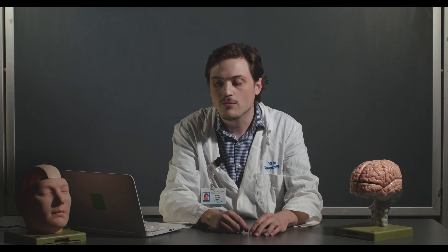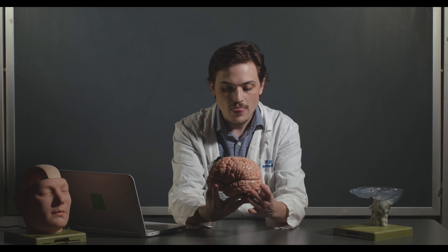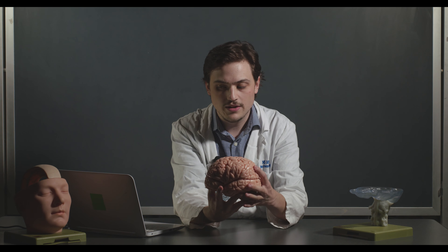So today we're going to do a sheep brain dissection. But before we get started, I wanted to talk about how we orient ourselves when discussing structures relative to one another, or when talking about the front versus the back of the brain. This is what's covered on the first couple of slides, and I'm going to use this human brain model to demonstrate.